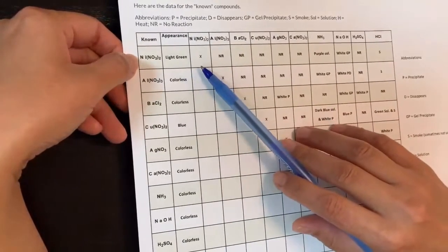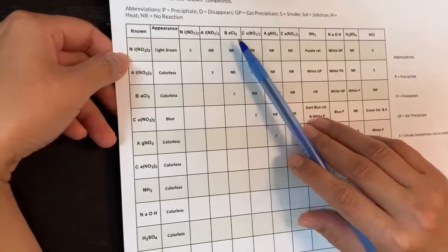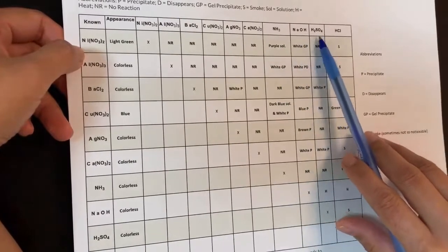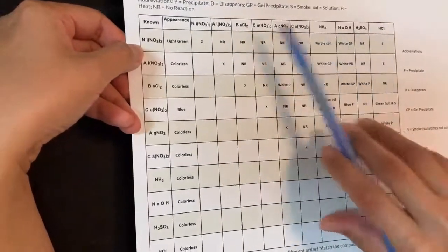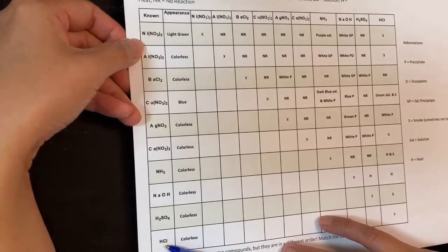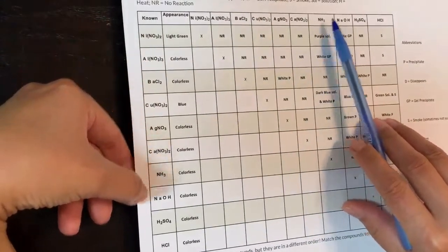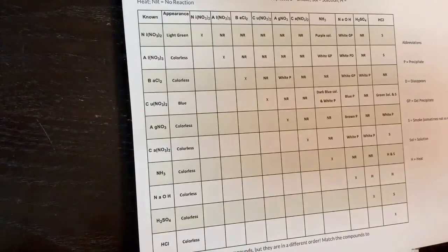We have 10 different chemicals: nickel(II) nitrate, aluminum nitrate, barium chloride, copper(II) nitrate, silver nitrate, calcium nitrate, ammonia, sodium hydroxide, sulfuric acid, and hydrochloric acid. The same exact order of chemicals is repeated on both sides of the grid — nickel, aluminum, barium, copper, silver, calcium, ammonia, sodium hydroxide, sulfuric acid, and hydrochloric acid.